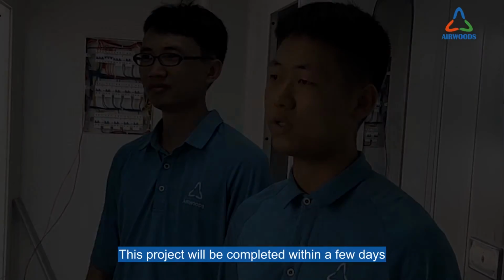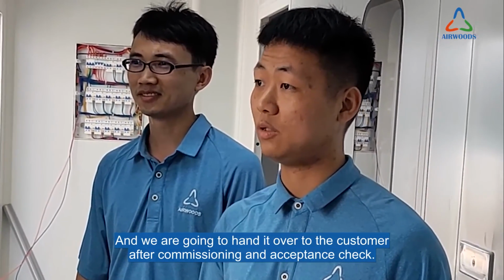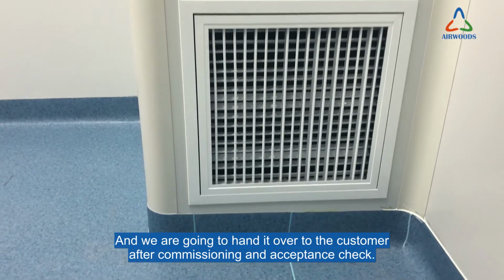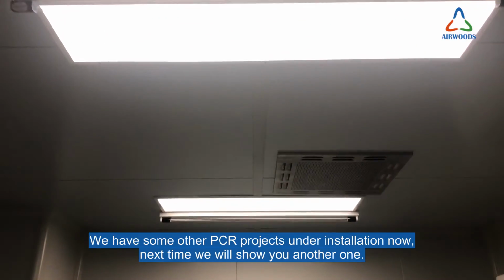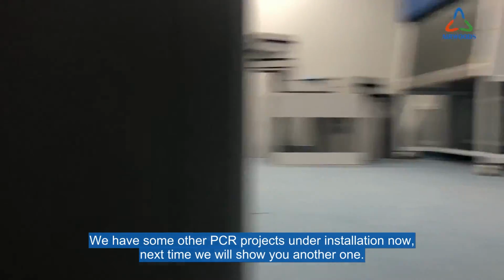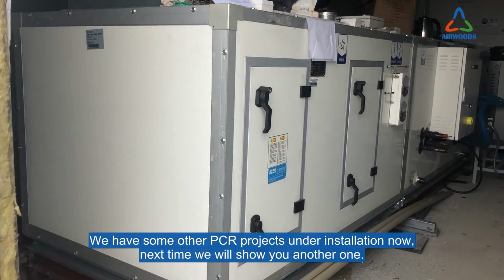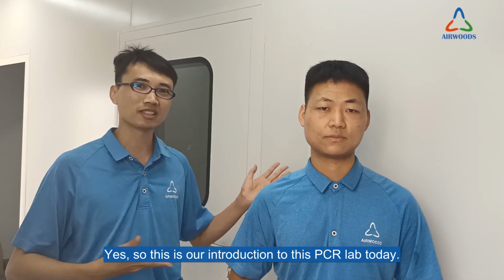This project will be complete in a few days, and we are going to hand it over to the customers after the acceptance and commissioning work. At the same time, we have some other PCR labs under installation now, so next time I will show you another one. Yes, and this is the introduction for this PCR lab today.